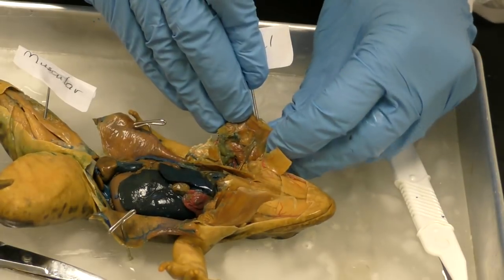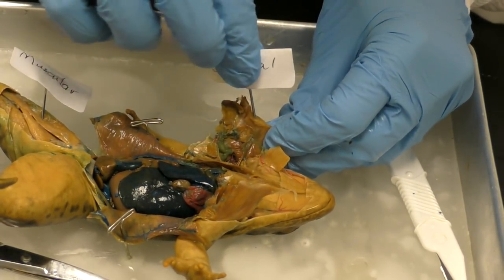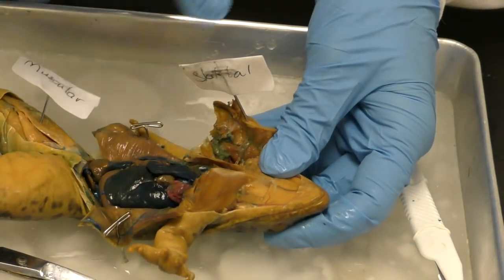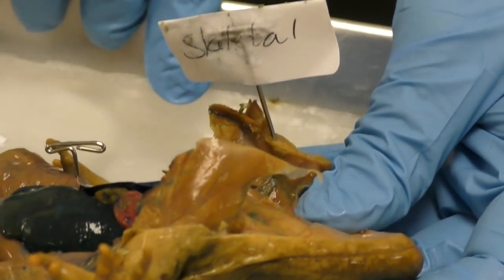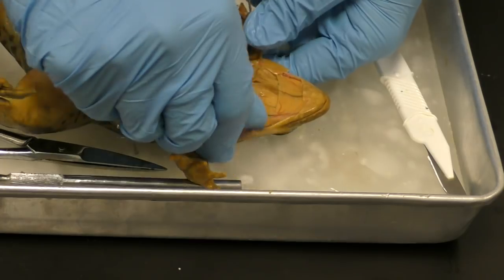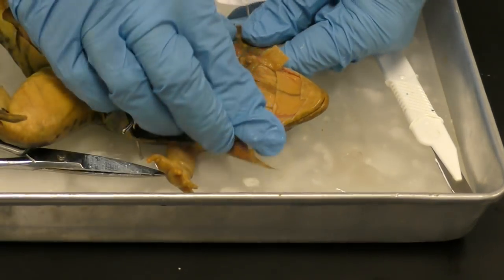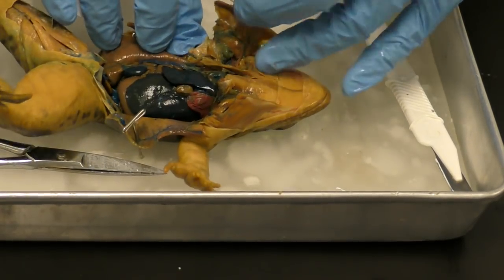So sometimes I can get in the middle of the bone. Okay, so I labeled skeletal system. Okay, skeletal system, all right. I am gonna have to remove that because it's kind of getting in our way. We have labeled 3 systems, and then we've got 2 more to go.